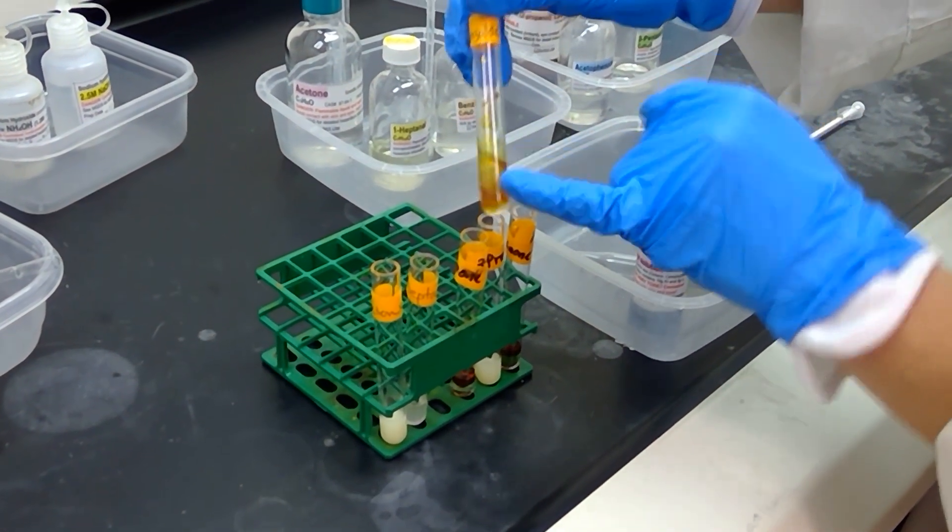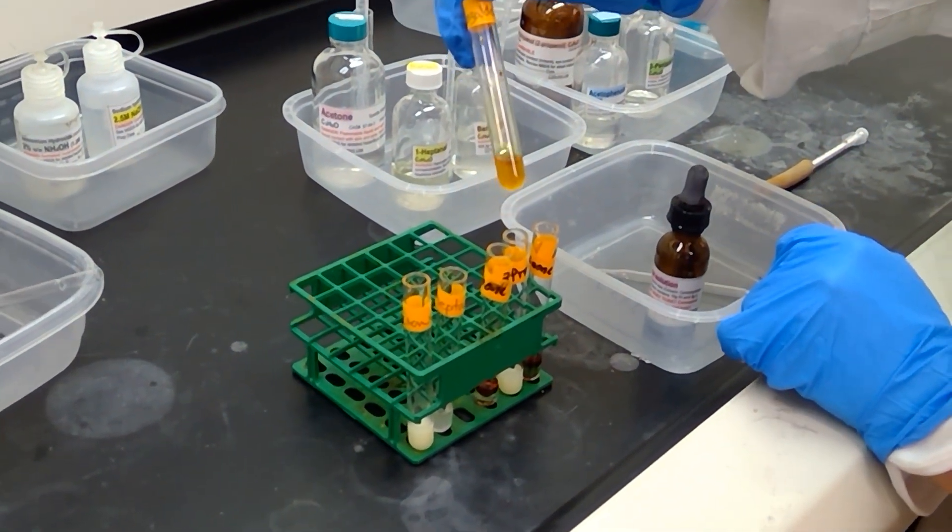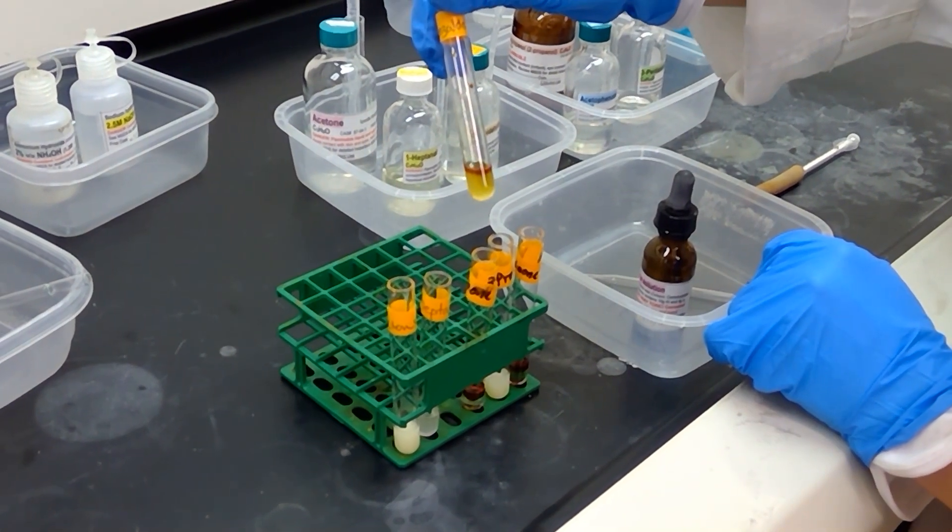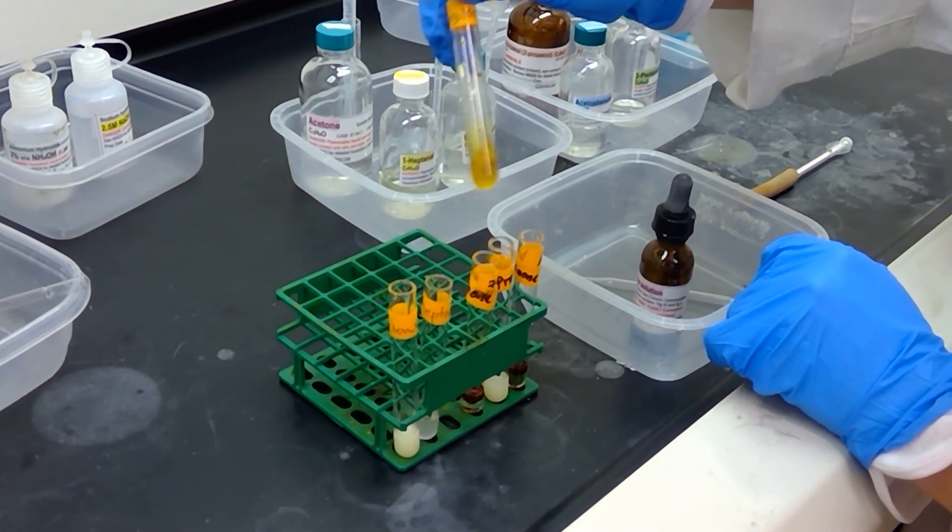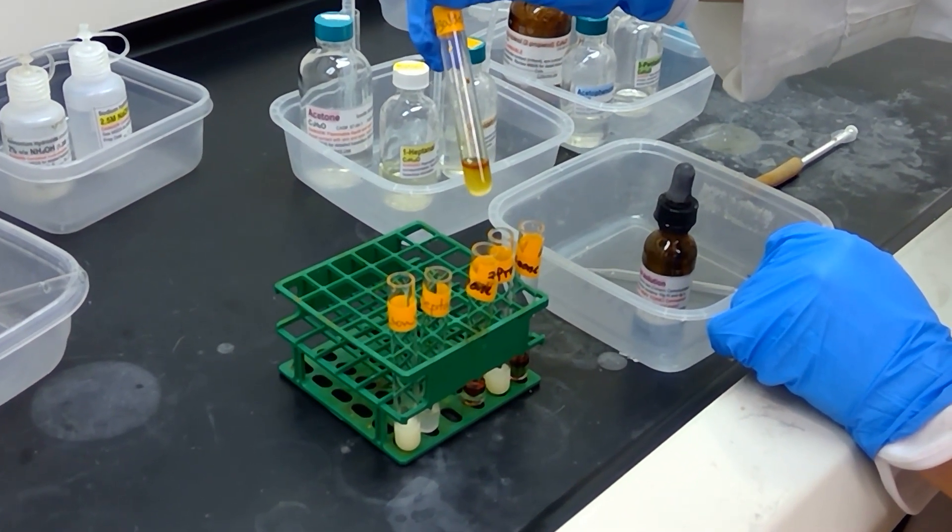Benzaldehyde, which is an aldehyde, is not really reacting here. The solution is yellow but we have no precipitate forming.